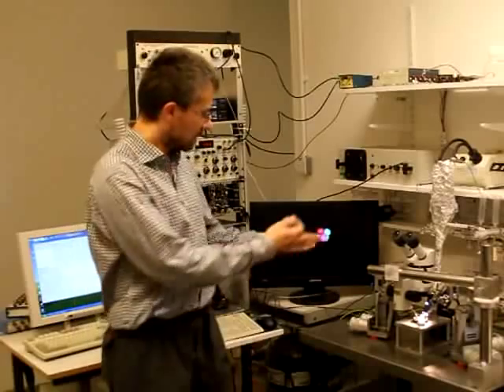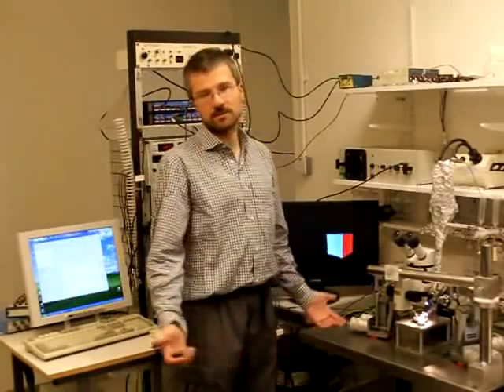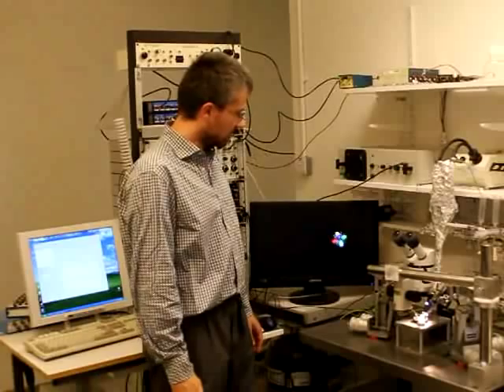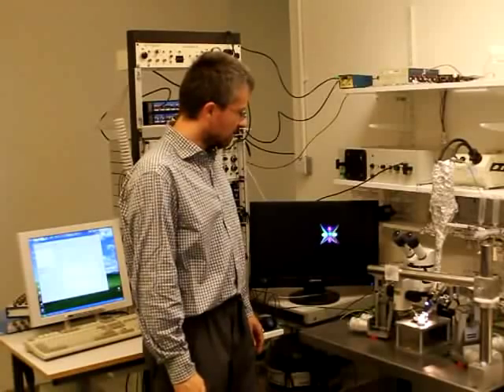To begin with, I'll just introduce the main hardware components. So what we have here is the standard electrophysiology rig, what you usually would have in any electrophysiology lab.